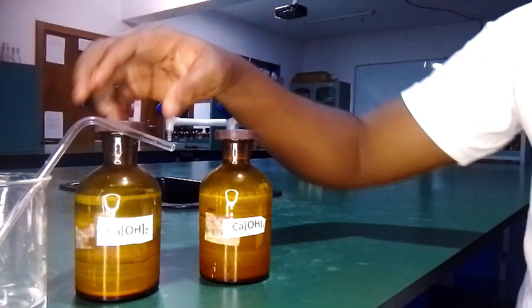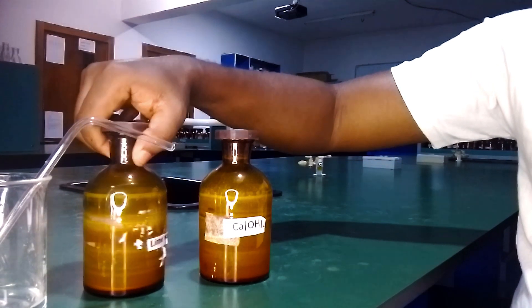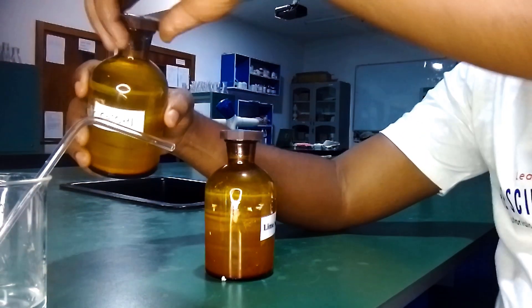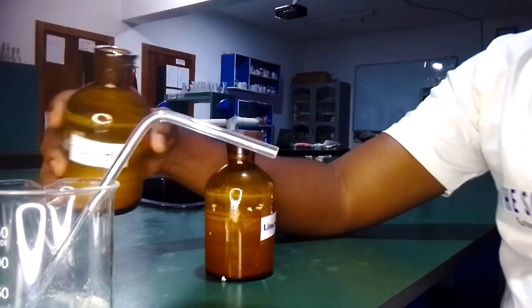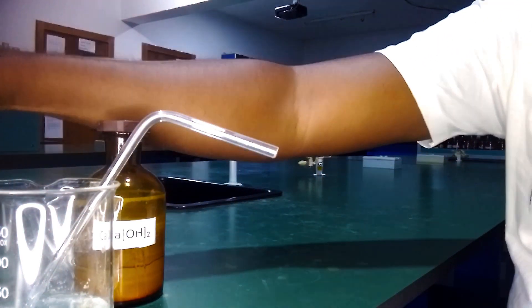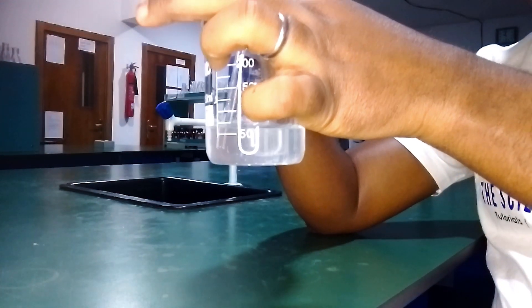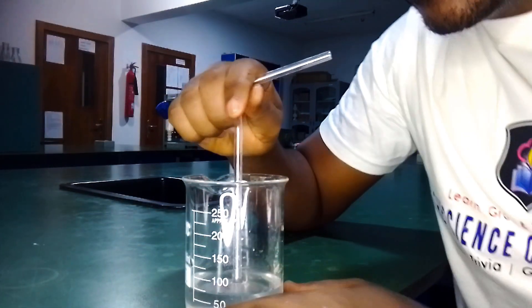You can see this calcium hydroxide — this is lime water, it's the same thing. Let me add a bit more to this. So that's the calcium hydroxide solution, or lime water, and we are going to start the process. You can see it's colorless — so let's start, watch me.